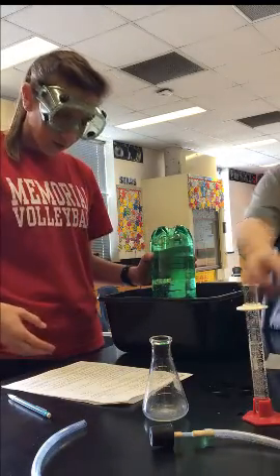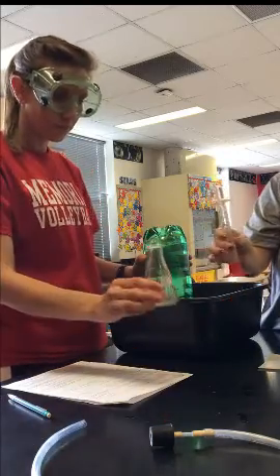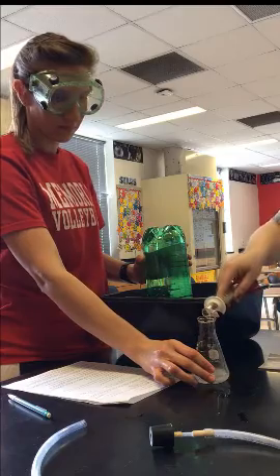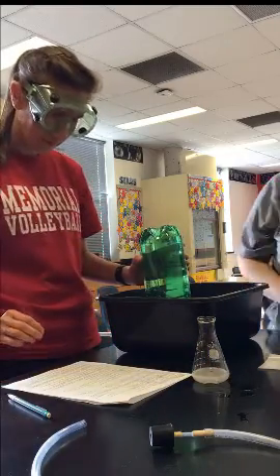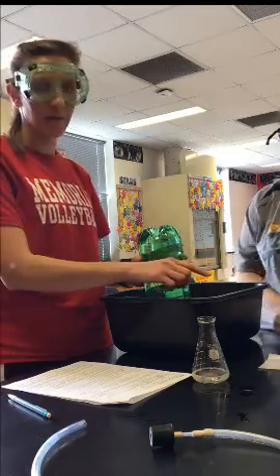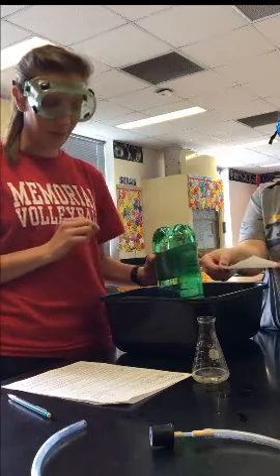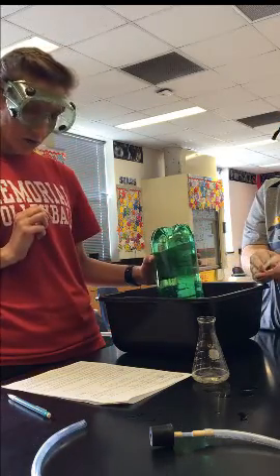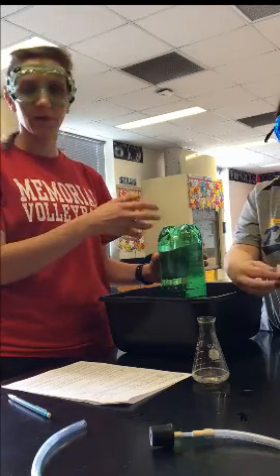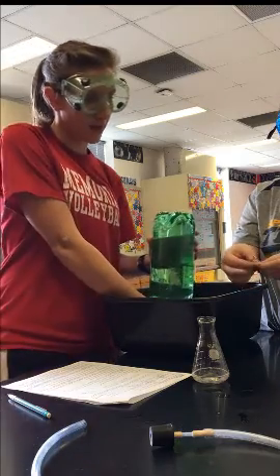We're going to take our 10% hydrogen peroxide that we've measured out and pour that into our 125-milliliter Erlenmeyer flask. We've already done step six, which is putting the weighing paper on the balance and measuring out 0.7 grams of potassium iodide. The next step is to make a package by folding the weighing paper so that it creates a package around the potassium iodide.